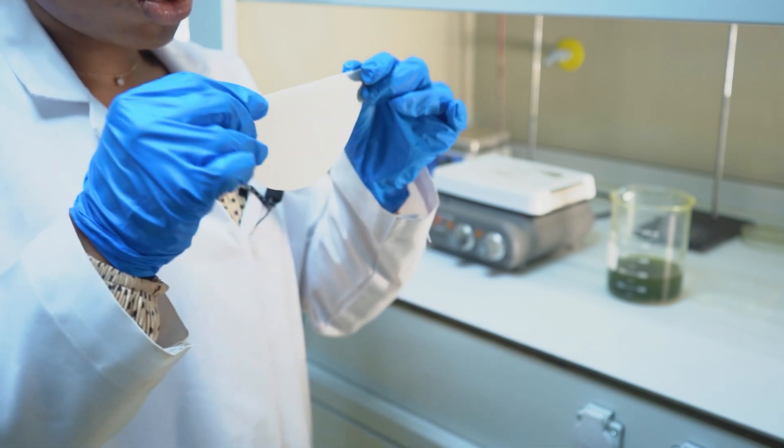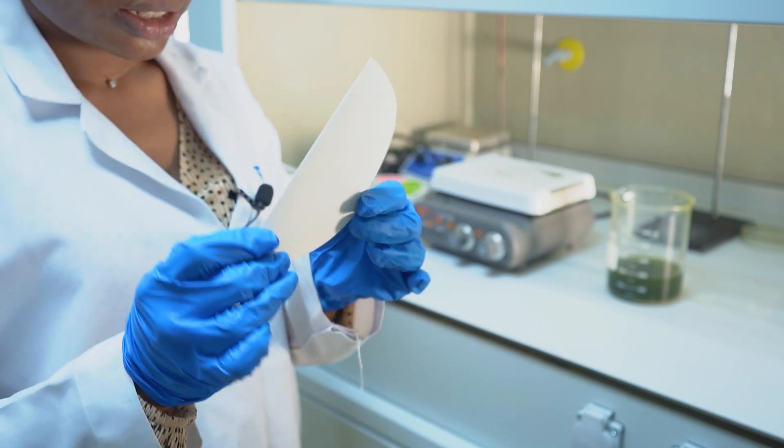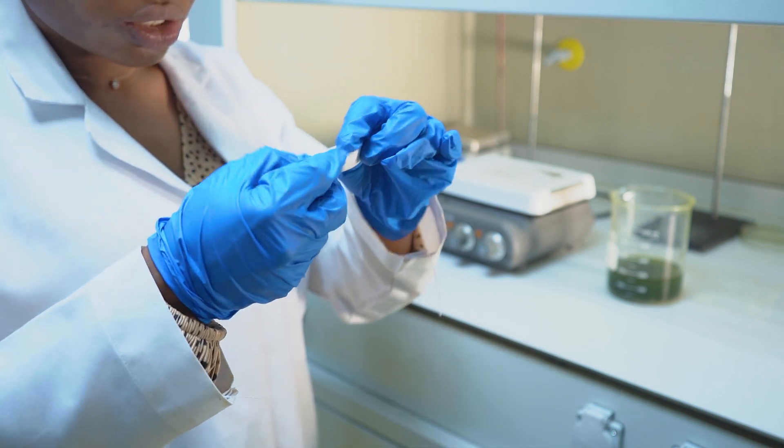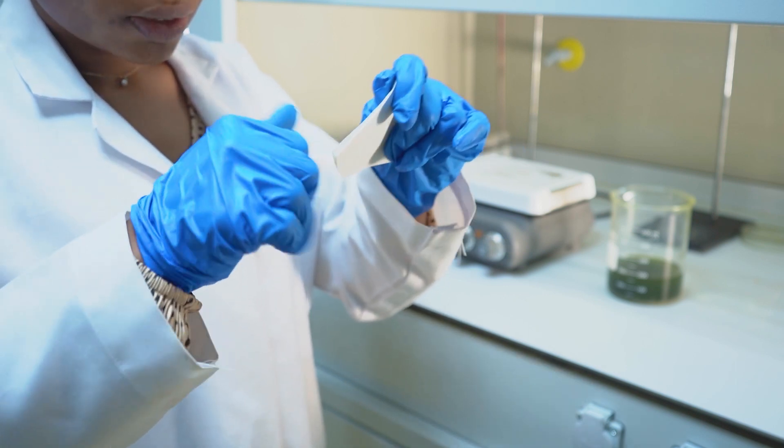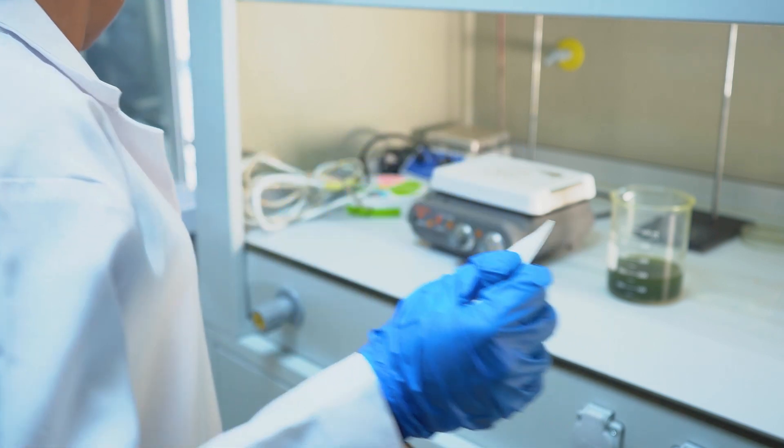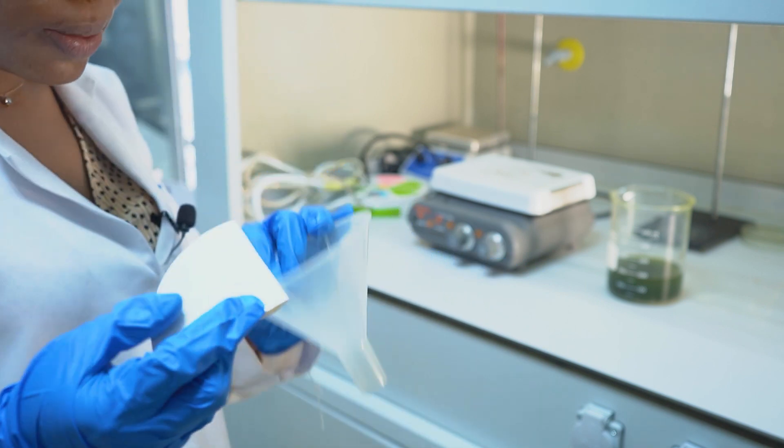This is how to fold the filter paper. Divide it into two, you have something like this, then further divide to fit in the funnel. So this is my funnel.